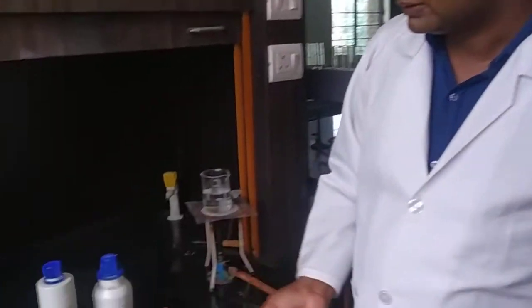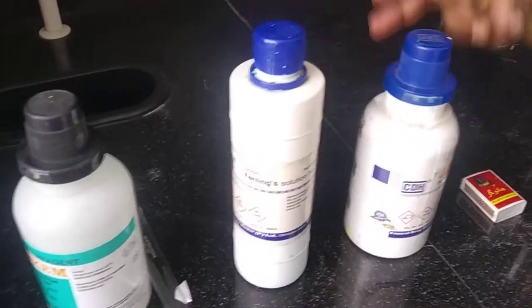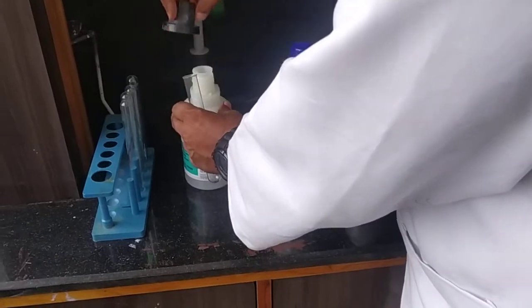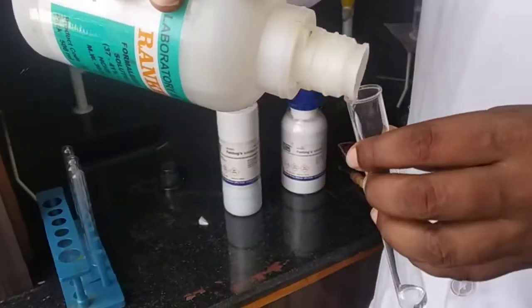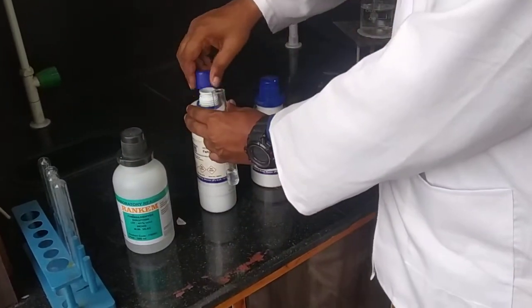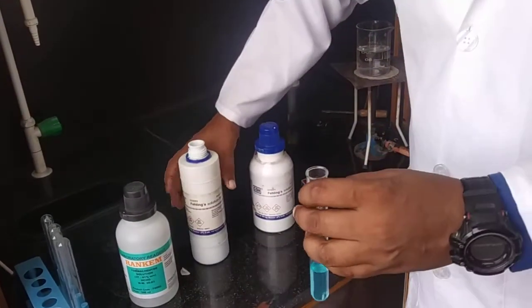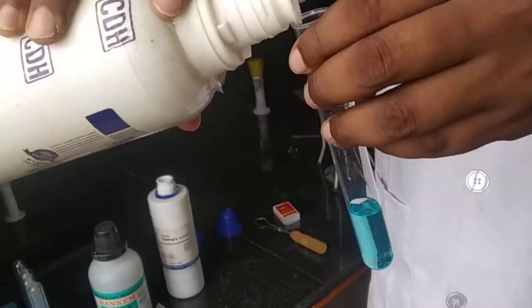Let's perform the second test of aldehyde group with the help of Fehling's solution A and Fehling's solution B. First, we take a clean test tube and add 1 or 2 ml of organic compound. Now add an equal amount of Fehling's solution A and Fehling's solution B as a mixture. Be careful — the quantity of Fehling's solution A and Fehling's solution B must be equal.